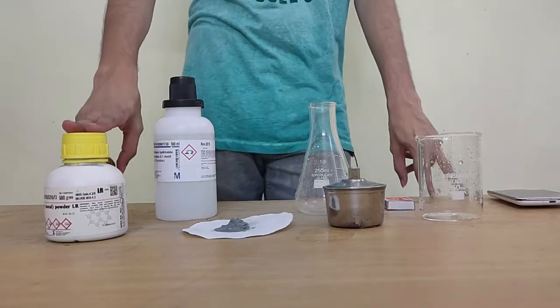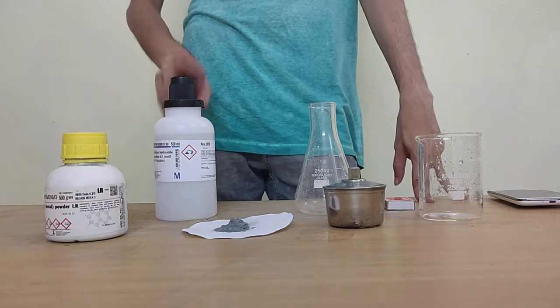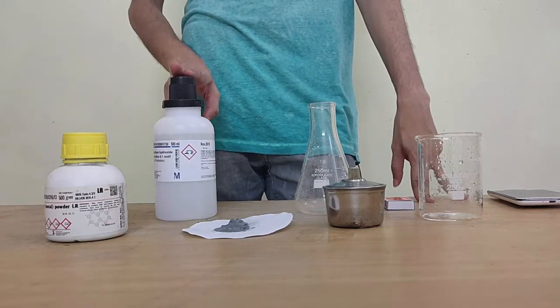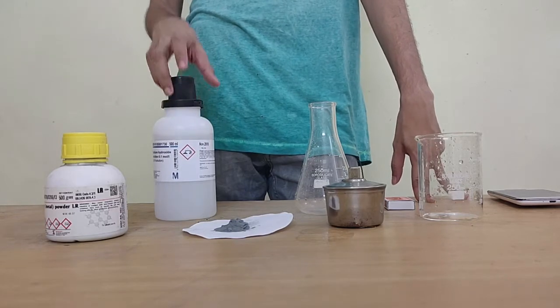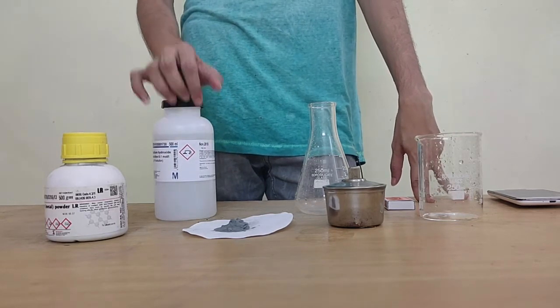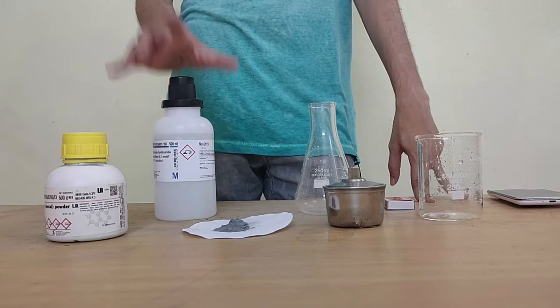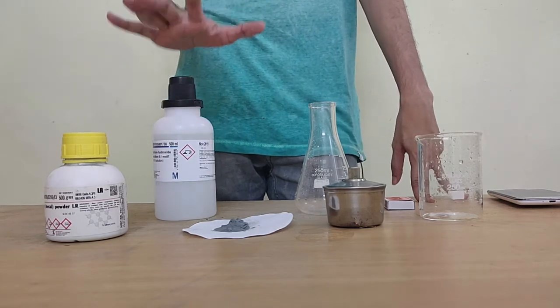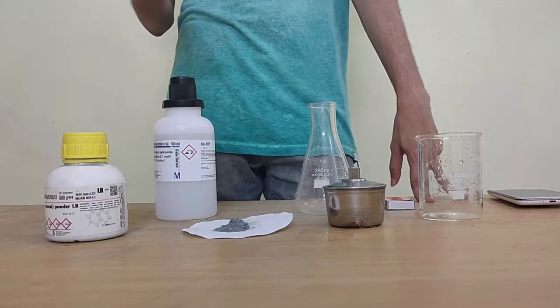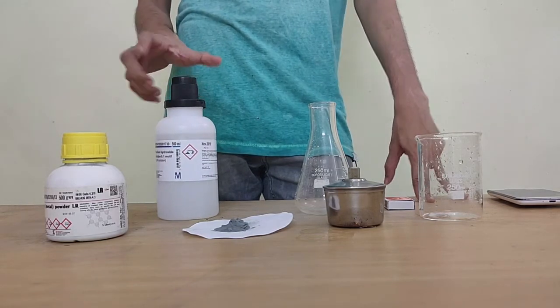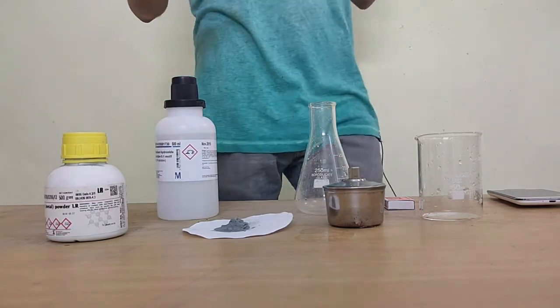I have a metal and a base. Today I will be using zinc metal powder like we did yesterday, and I will also be using another base and that is sodium hydroxide. This is the base that we used for the indicator test. It's very strong, need to be very careful when we do this experiment.